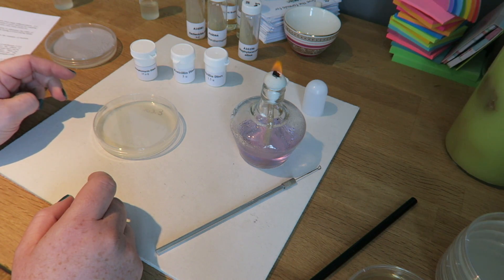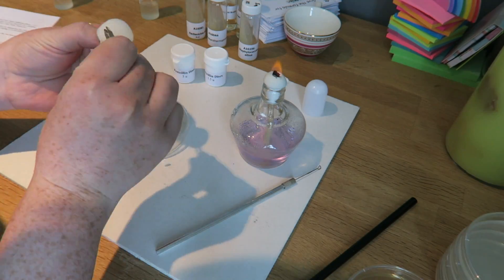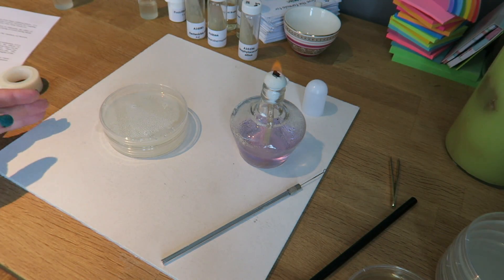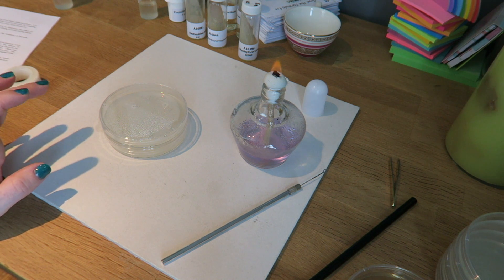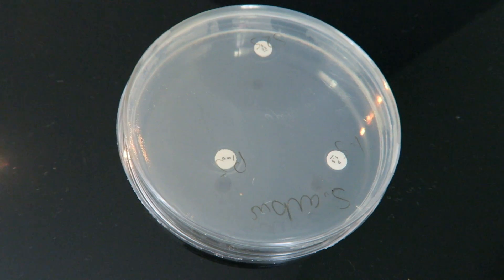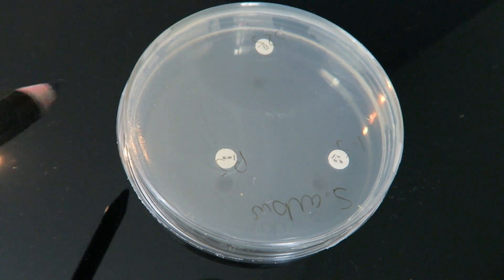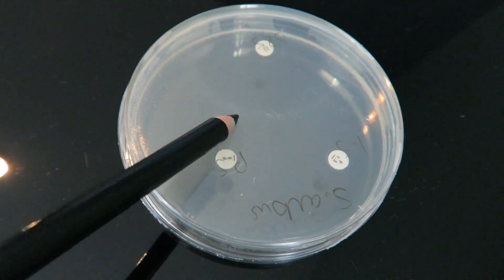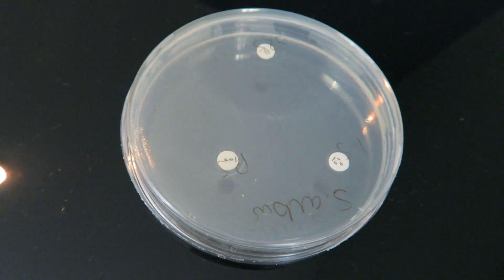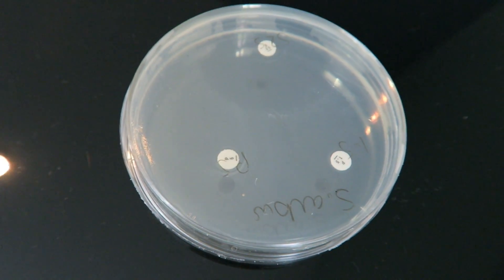Then we can follow the growth of the bacteria up to and around the disc and test the sensitivity. We can now leave those to grow over a few days and then look at the growth later. Having incubated the plate for a few days, you can see we have our antibiotic discs and bacteria has grown around them. If you look here, very, very faint, hopefully you can see a clear zone around this antibiotic disc.